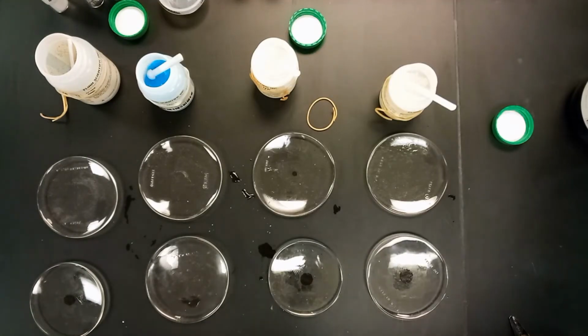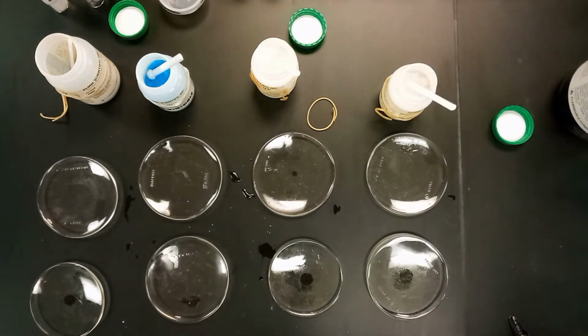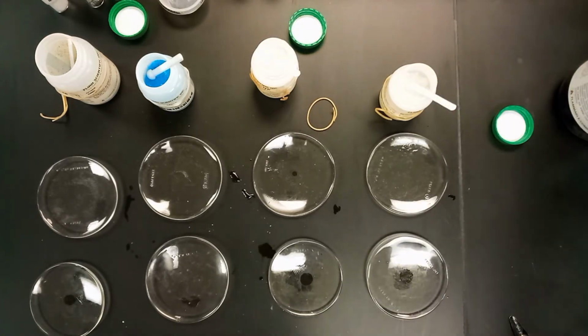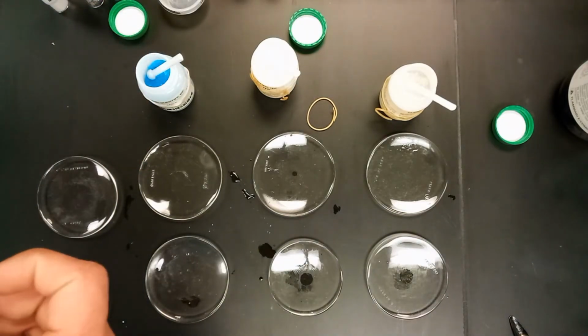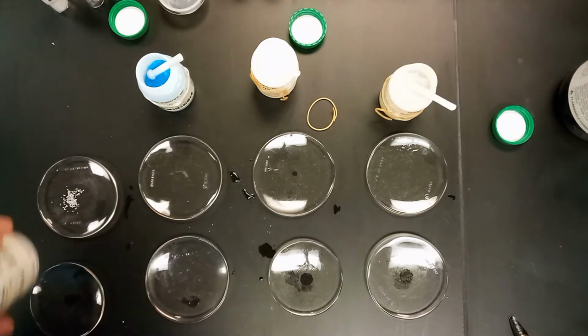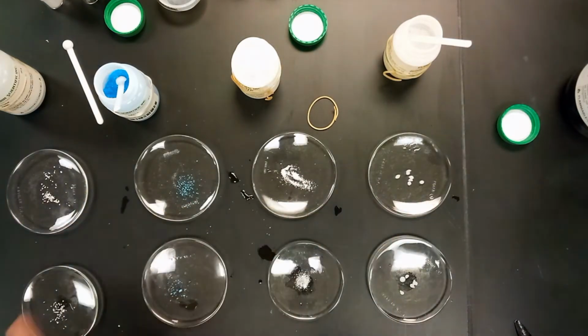Do a very similar process again here for more solubilities, but this time we're going to be using hexane and some ethyl alcohol, just any alcohol really, to get some more data points. So I'm just going to go ahead and put some more zinc in this one and all the way down. Serving trays all set up, so we can go ahead and add some. We'll put hexane on the top row and alcohol on the bottom row.